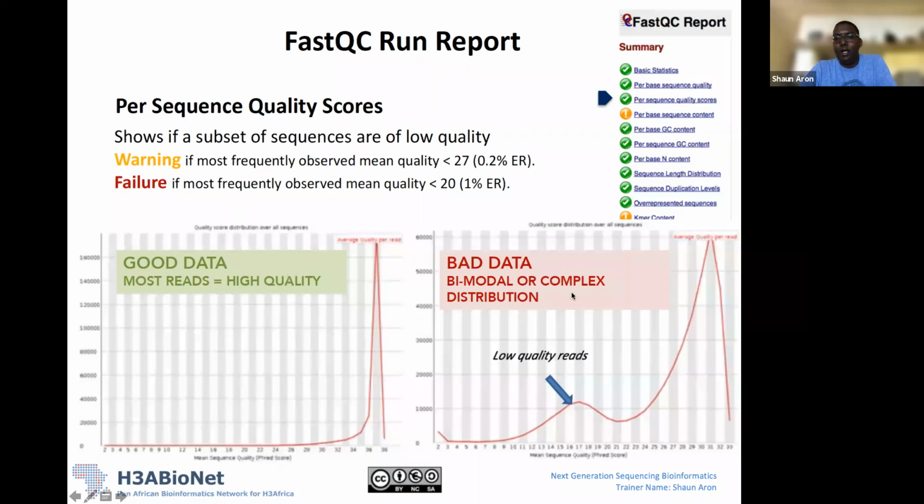What we'll see here is an example of questionable data. You'll see what we call a bimodal graph. We have a reasonable amount of our reads, in this case 60,000 of our reads, in the region of 27 to 32, 33. But we also have this bump here where we have about 10,000 of our reads with a mean sequence quality phred score of around 16 or 17. So this again is something that would be a red flag to note.